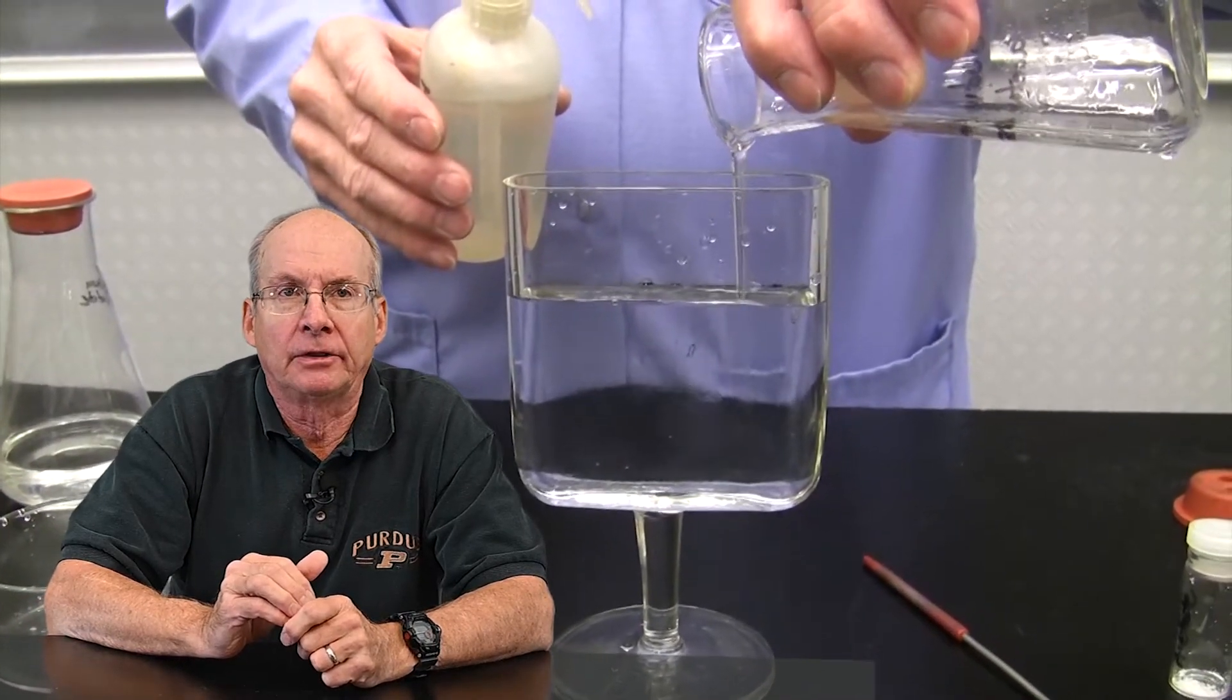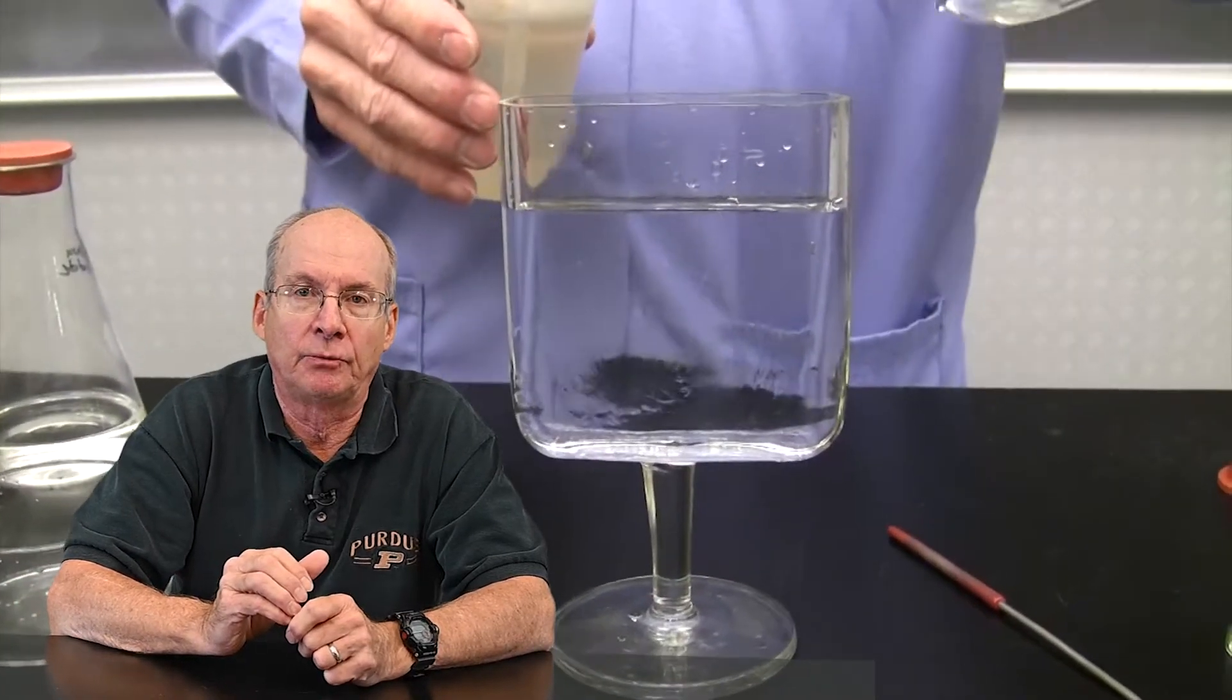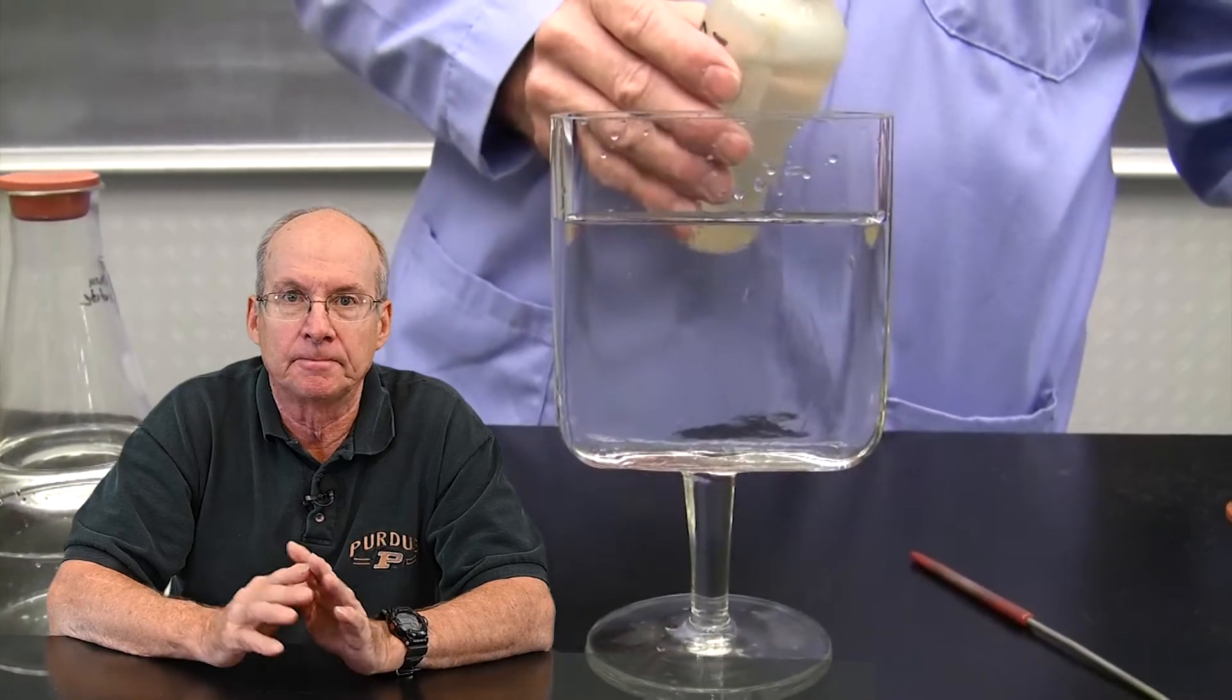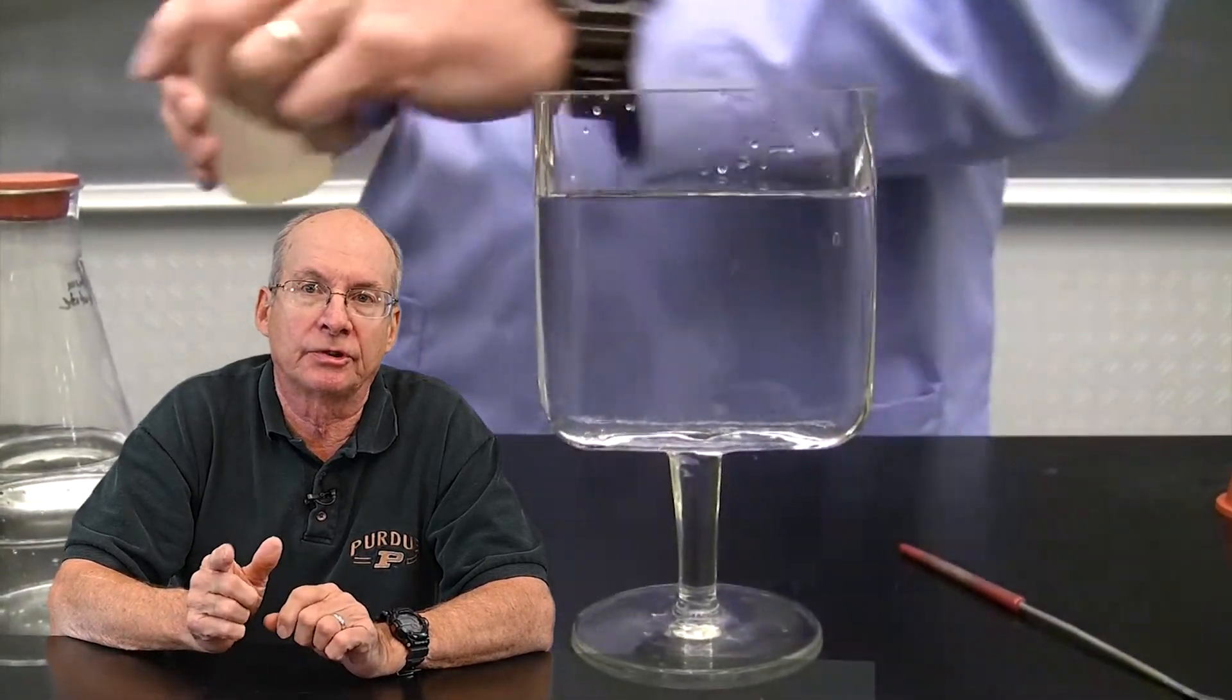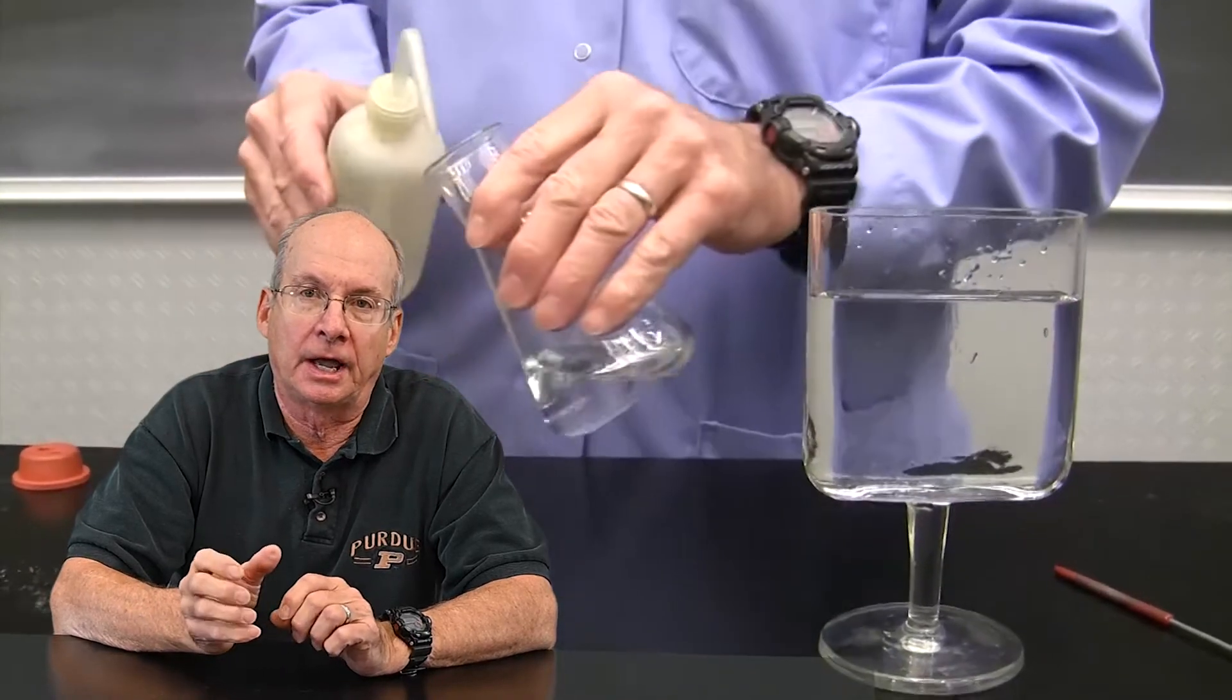So you add a little water to make sure that you're not adding new crystals back to it as it gets liquid, and then once you've got it completely liquid, then you usually do a quick rinse at the top of the flask with deionized water and then seal it up.